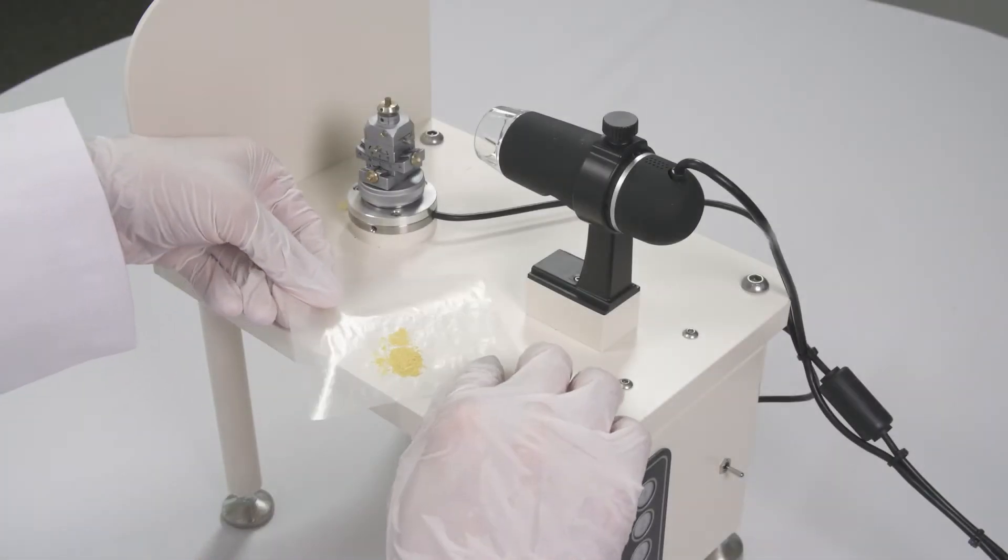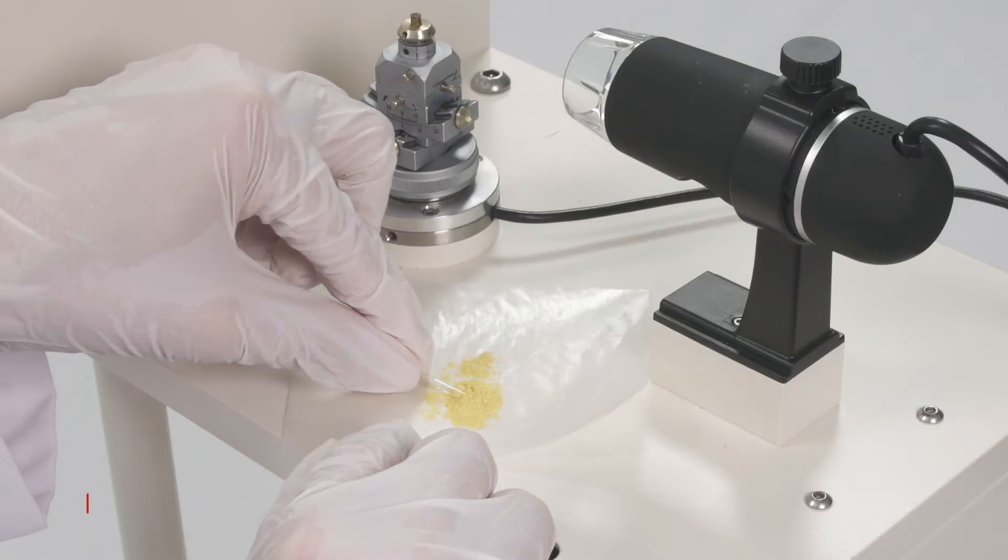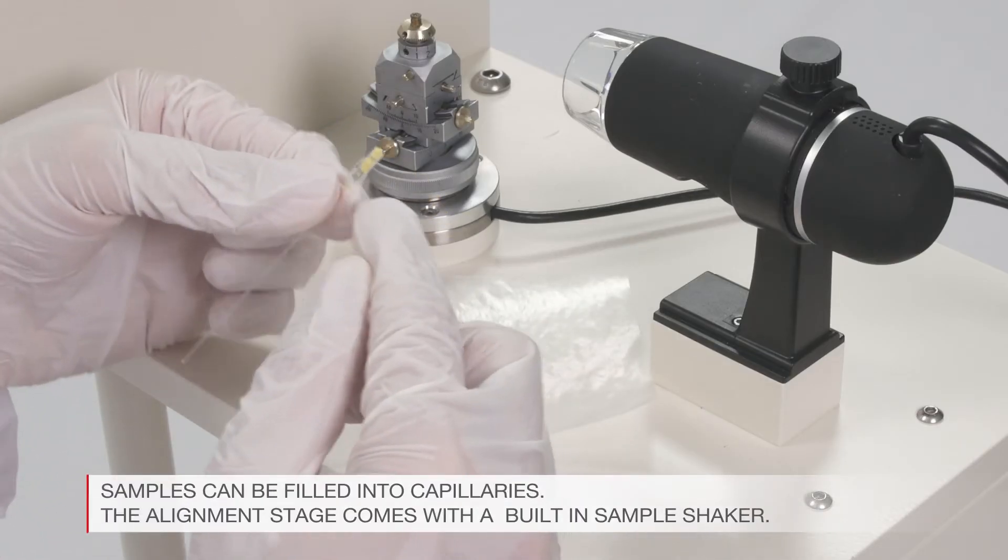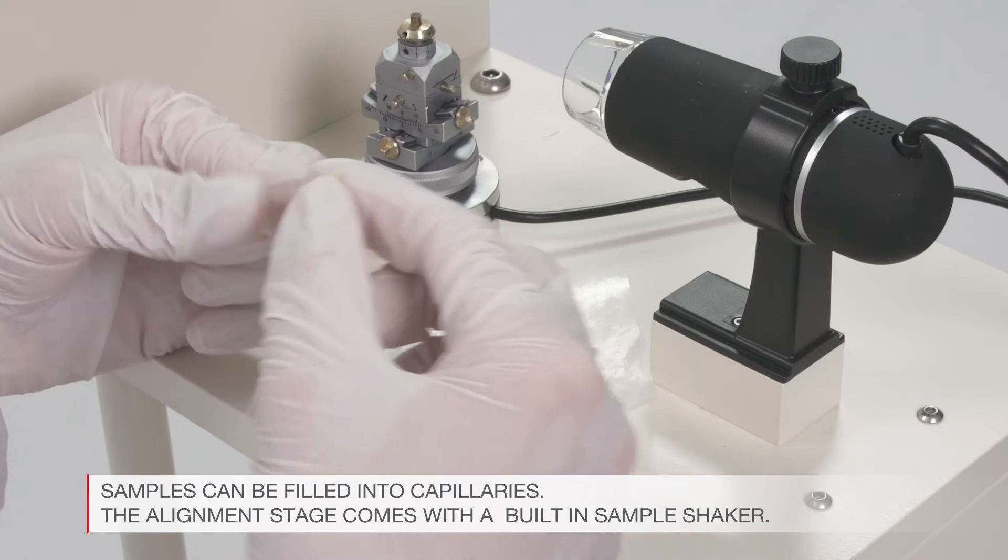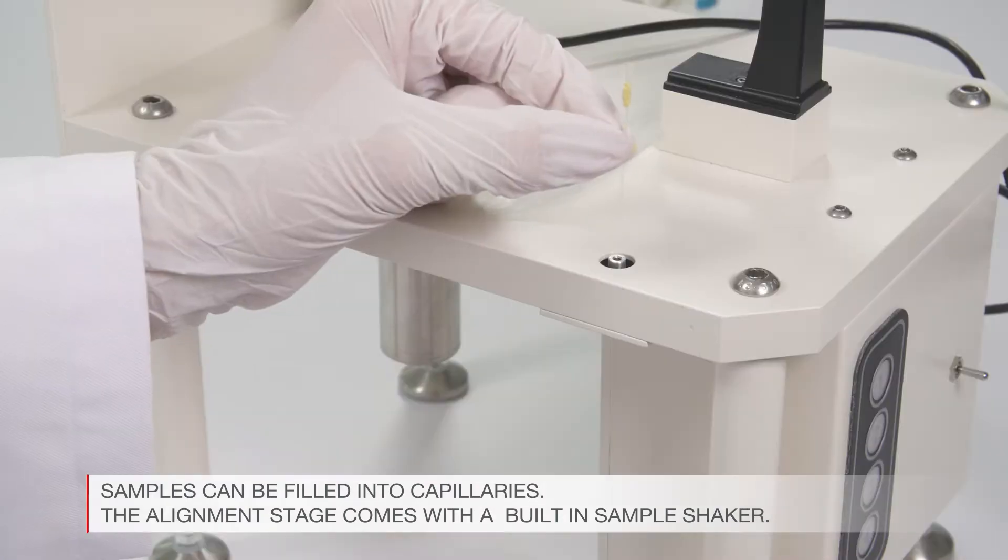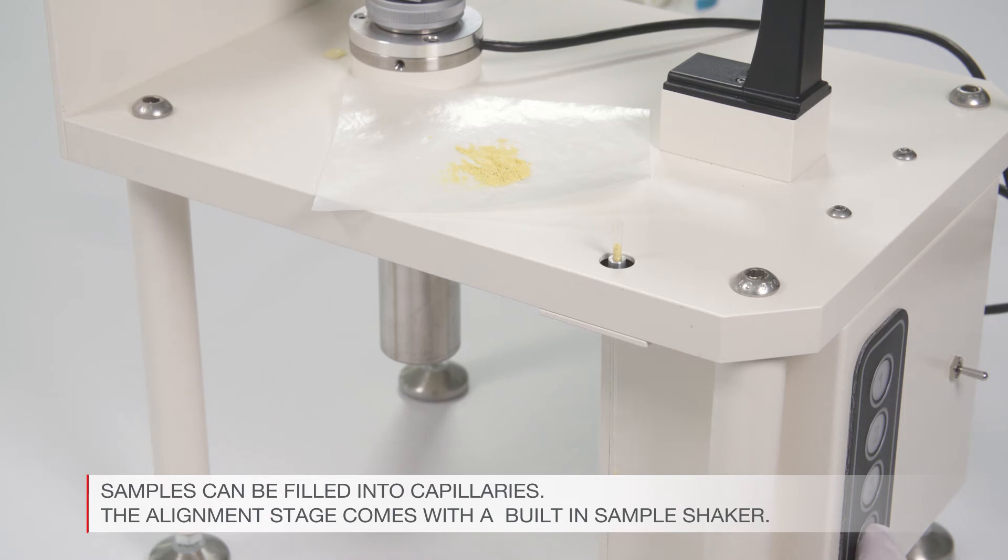Air sensitive or small sample amounts can be filled into capillaries. Samples can be retrieved after high-quality data collection. To fill a capillary, the sample is filled from the top.